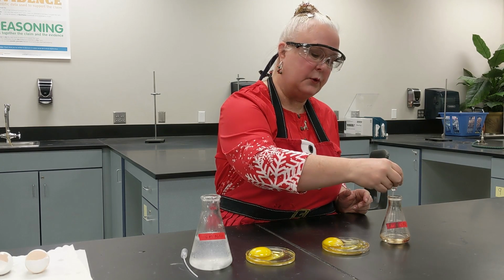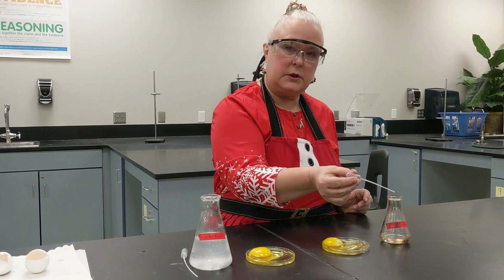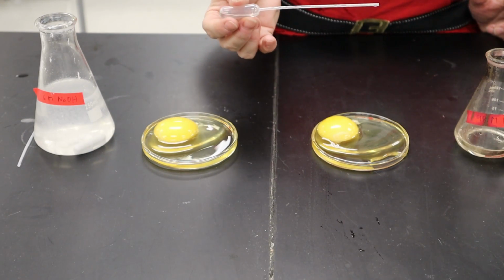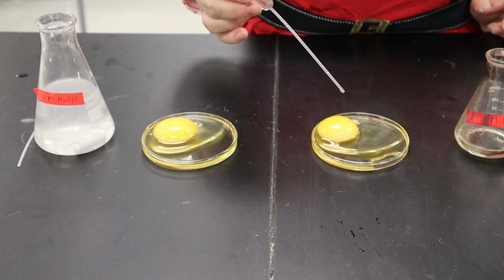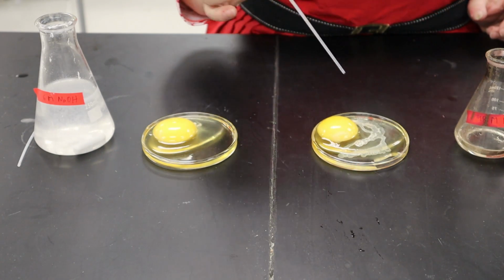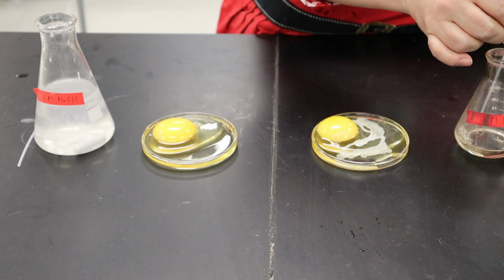And here is some sulfuric acid. We would use this in our classrooms, and we're really careful about this. But as soon as you see white in the egg, then you're going to see that that could be damaging to your eye, and there's no way to return that. So let's count with me. 1, 1,000, 2, 1,000, 3, 1,000. And as soon as I pretty much hit that with the acid, it was white.